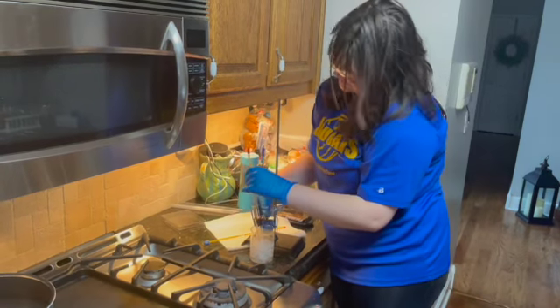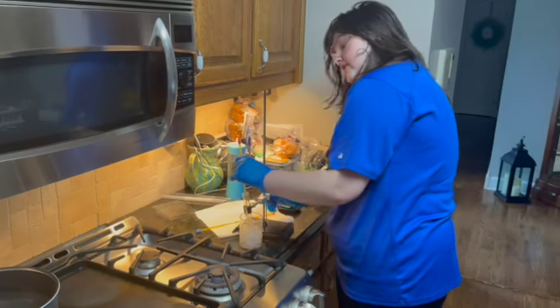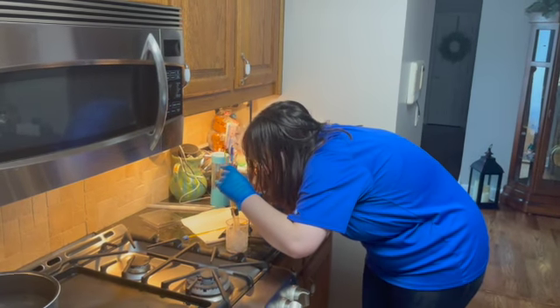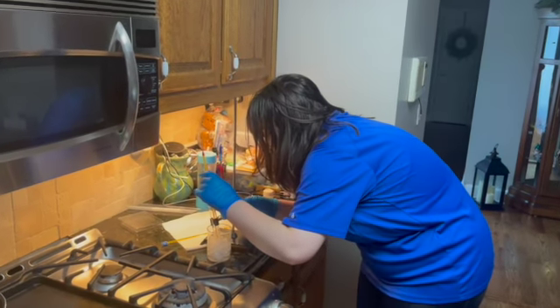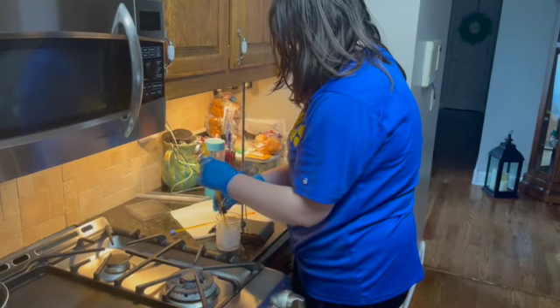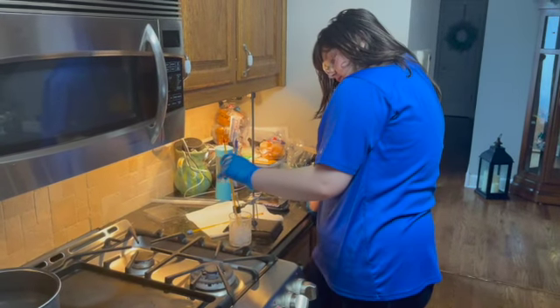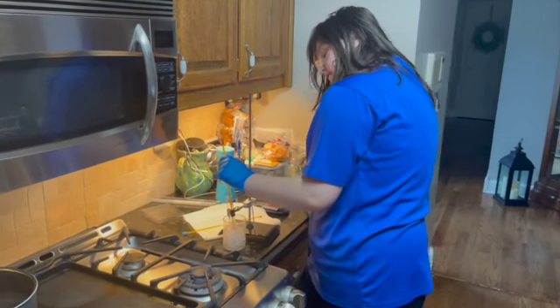And I'm getting a little suspicion that it looks to be almost completely frozen. It's kind of hard to tell at this point, so I'm going to need to pull it up just a little bit to check. Seems like there's still just a little bit left. So let me fasten this back in. Okay. We just have a little bit of liquid left to freeze over.